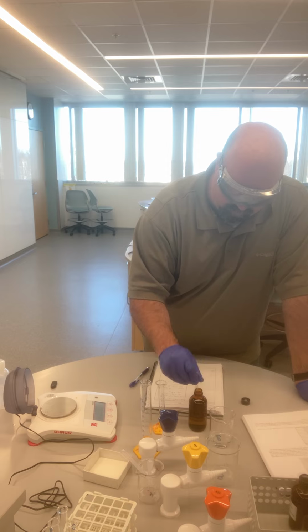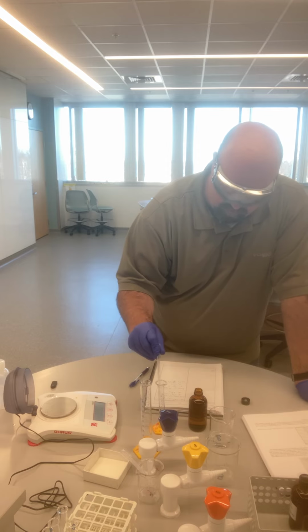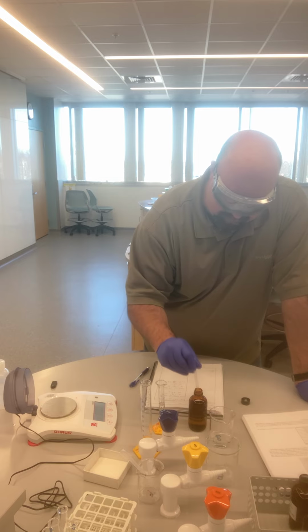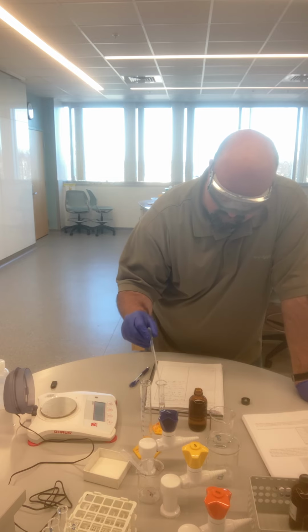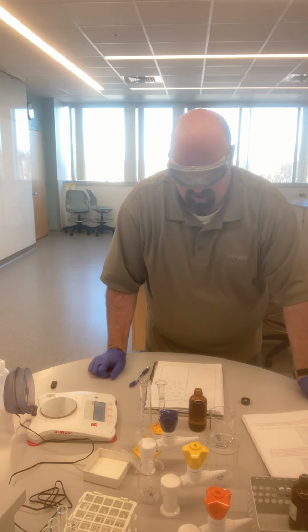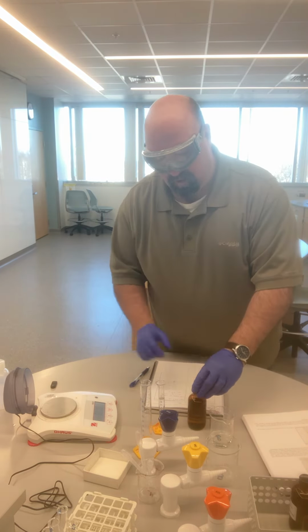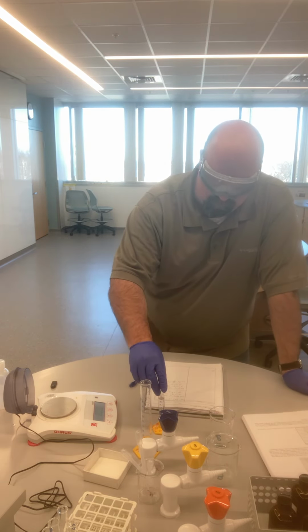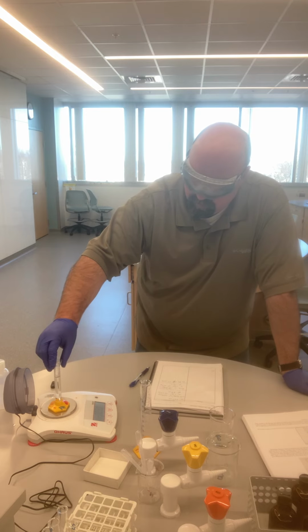Put some of liquid 3 into the cylinder. Now again, you want to be recording in your notebooks everything that I am doing. So I first place the graduated cylinder onto the balance. Now you wouldn't need to go into that much detail. You don't have to say, put the graduated cylinder on top of the balance, but you would want to write something to the effect of, found the mass of the empty graduated cylinder, because that is what I actually did.